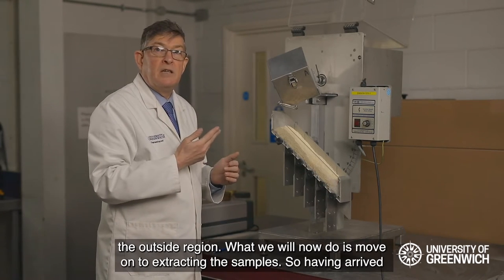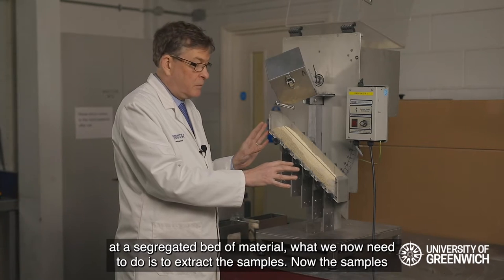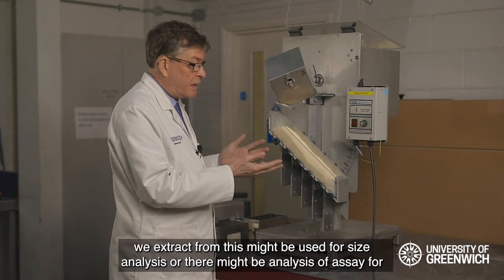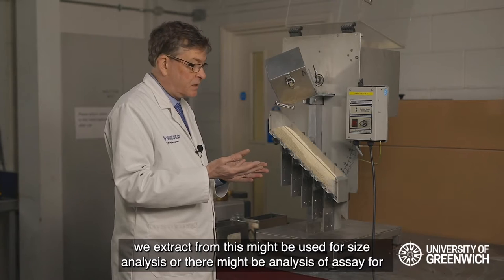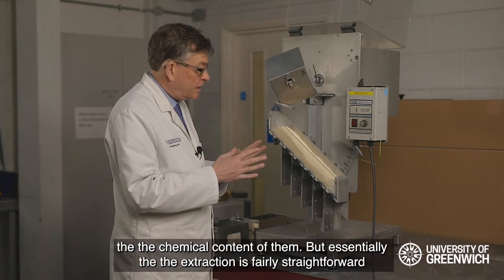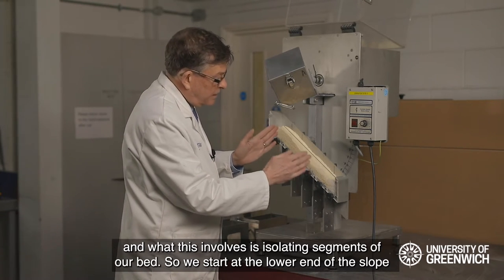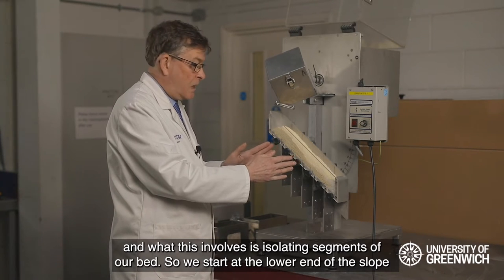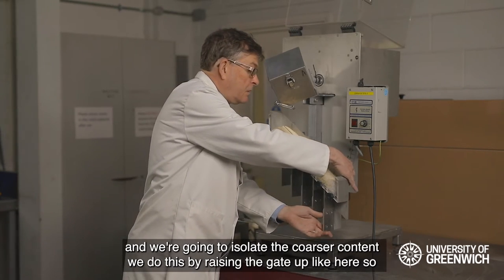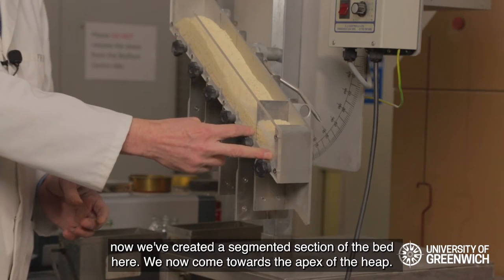This is basically the centre line of the heap; this is the outside region. We will now move on to extracting the samples. Having arrived at a segregated bed of material, we need to extract the samples, which might be used for size analysis or assay for chemical content. The extraction involves isolating segments of the bed. We start at the lower end of the slope to isolate the coarser content, and we do this by raising the gate up.